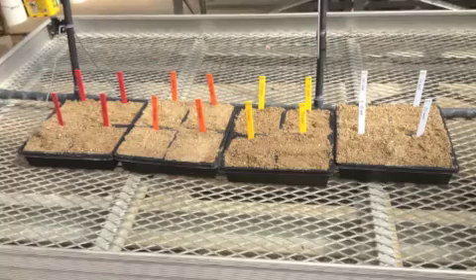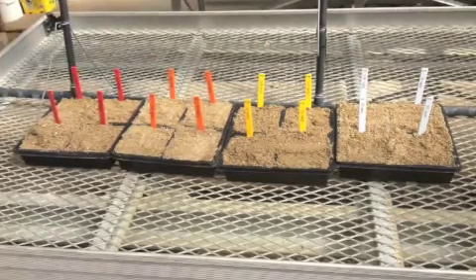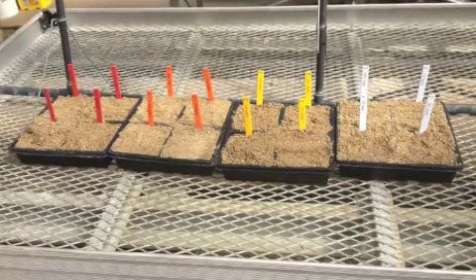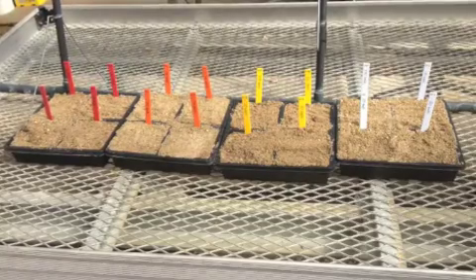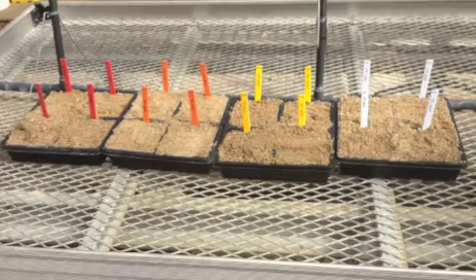For this lab, materials needed would be 16 containers, potting media containing a vermiculite mix, 0-10-10 fertilizer, ammonium nitrate, labels for containers, paper bags to collect samples, and shears.